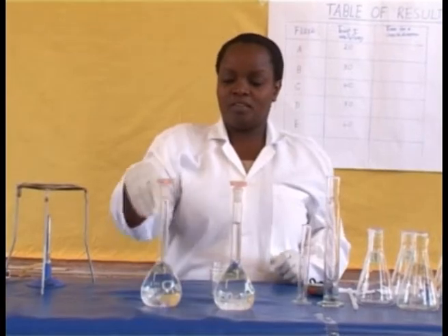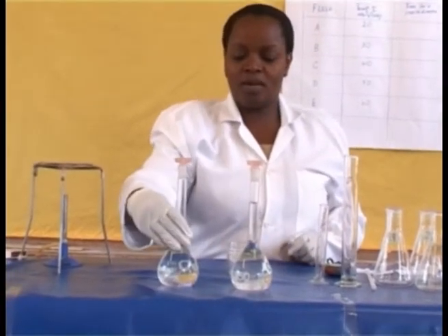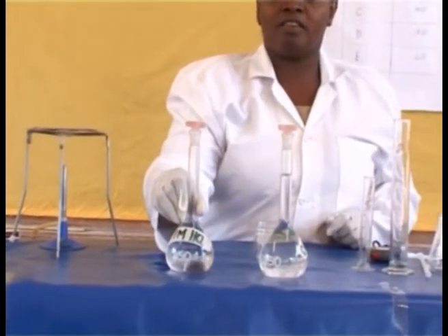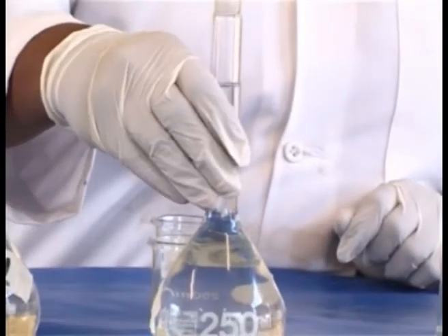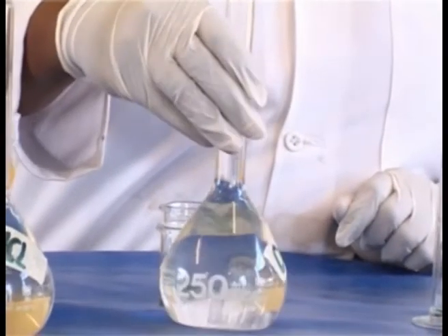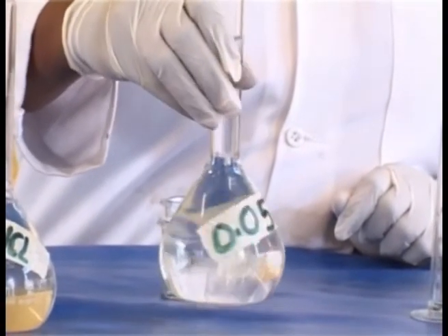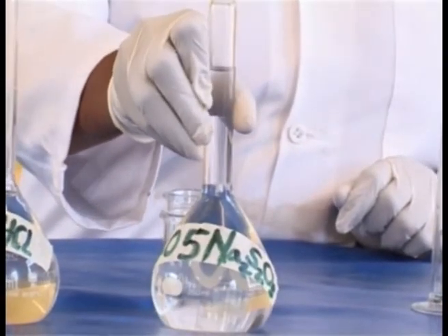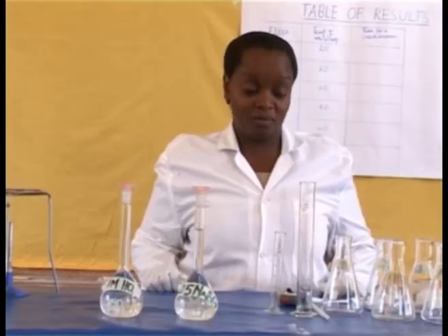Chemicals: 1 molar hydrochloric acid and 0.05 molar sodium thiosulfate.